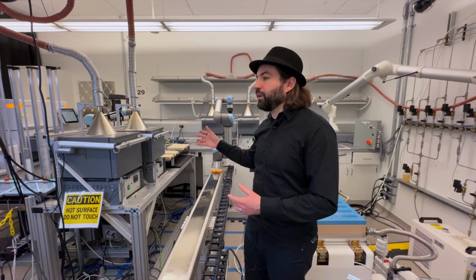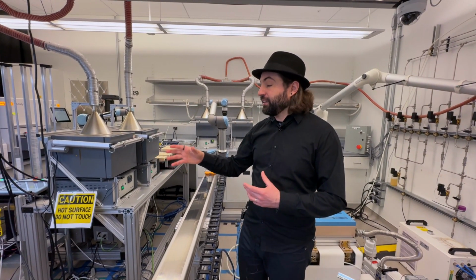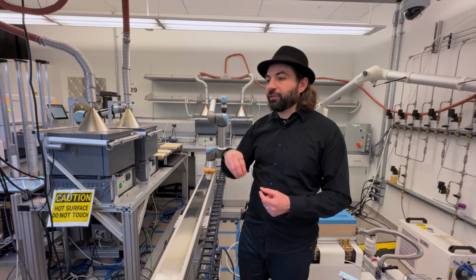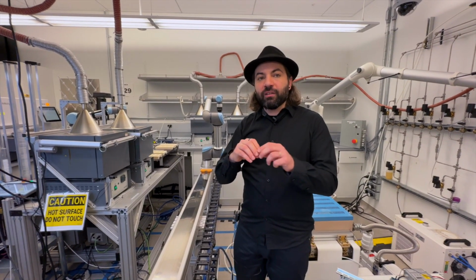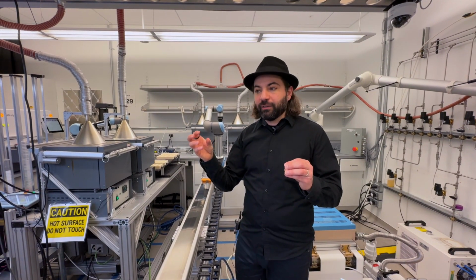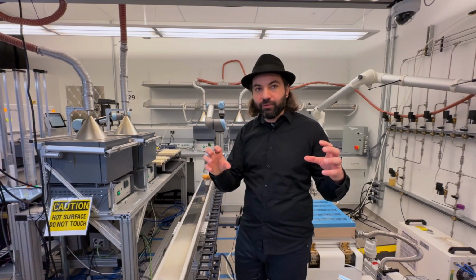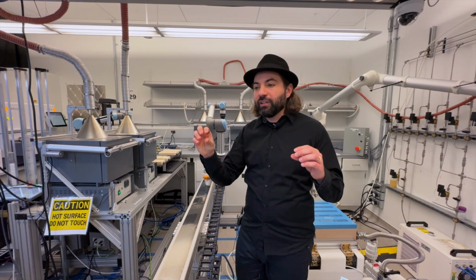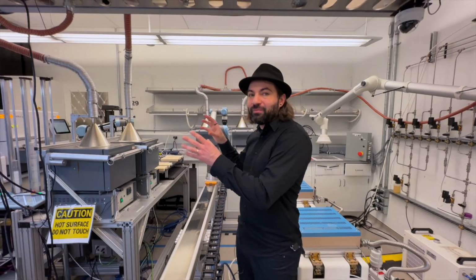I can have one batch coming in, and then the ALab OS even analyzes if, for example, some other scientist comes with a different reaction and sees that the temperature of the furnace will be the same for both of you, and the profile is the same. Then this software is going to try to combine your samples with the samples from the other scientist.